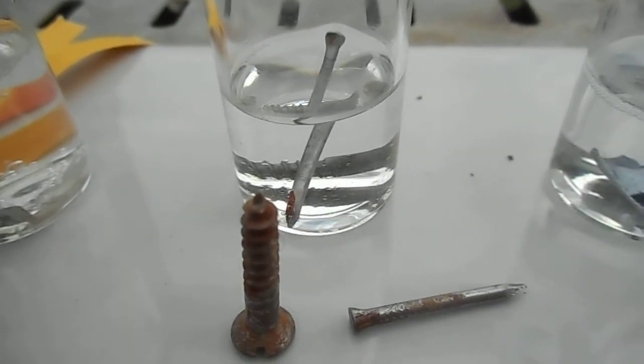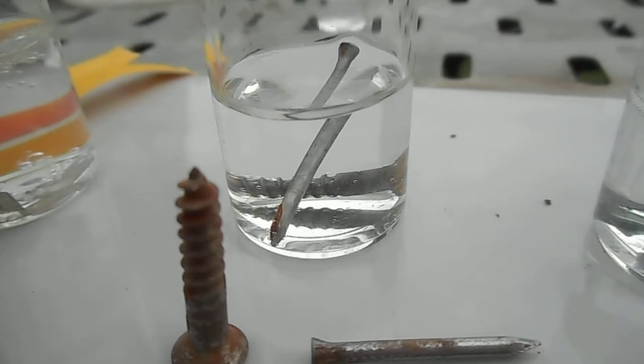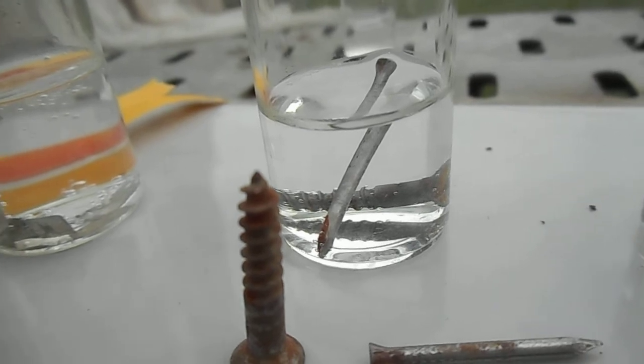Moving on to the iron. Well, we can see some small bubbles forming on the surface of the metal, but a very slow reaction.